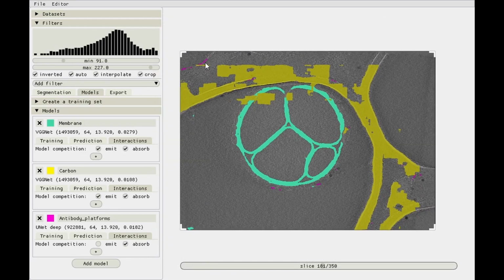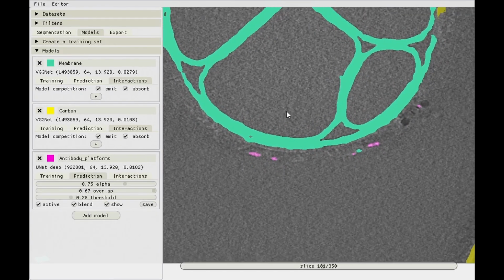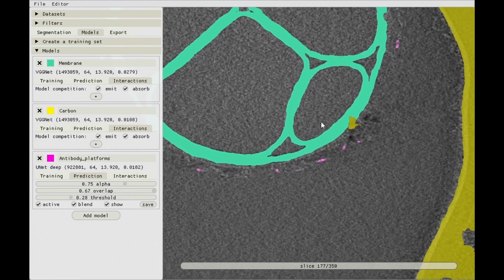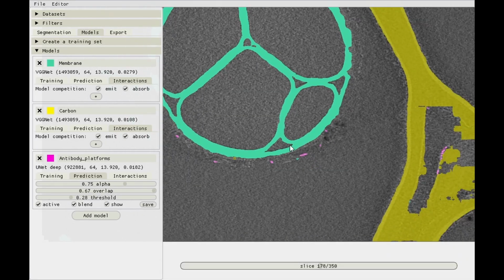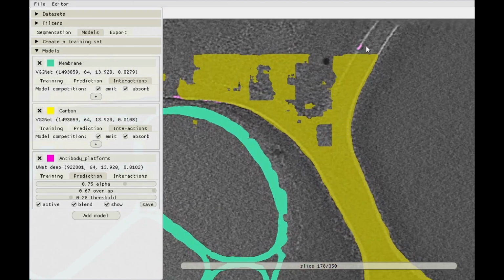But still, it's quite some stuff here and there. One easy way of getting rid of it is ignoring it. That sounds a bit silly, but when you look at these antibody platforms over here, and you browse the volume a bit, you can see that there's multiple consecutive slices where these platforms are predicted as platforms. So if in the final 3D segmentation we threshold and then look at particles sorted by volume, those ones will be a lot bigger than, for instance, this spurious little peak over here, which is not seen in the next slice, right? So just that there's some pink blobs here and there where we might not want them isn't necessarily a problem. It's only a problem if that prediction is there in multiple consecutive slices. So maybe that can also be a fix over here.